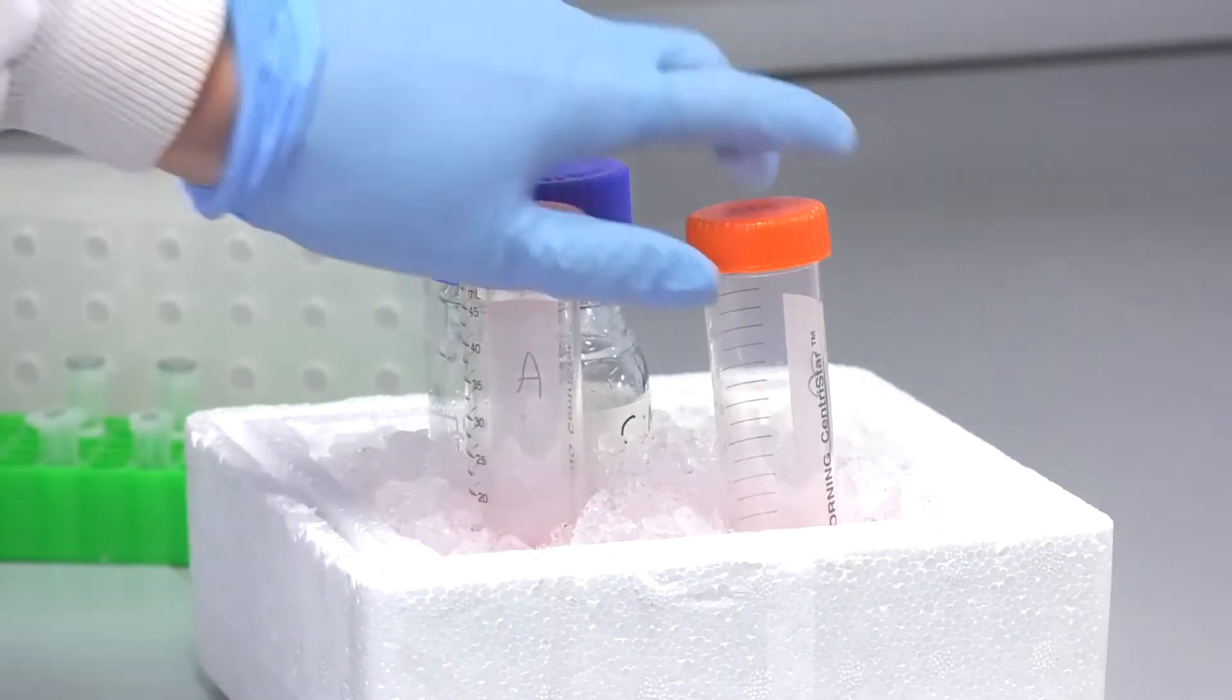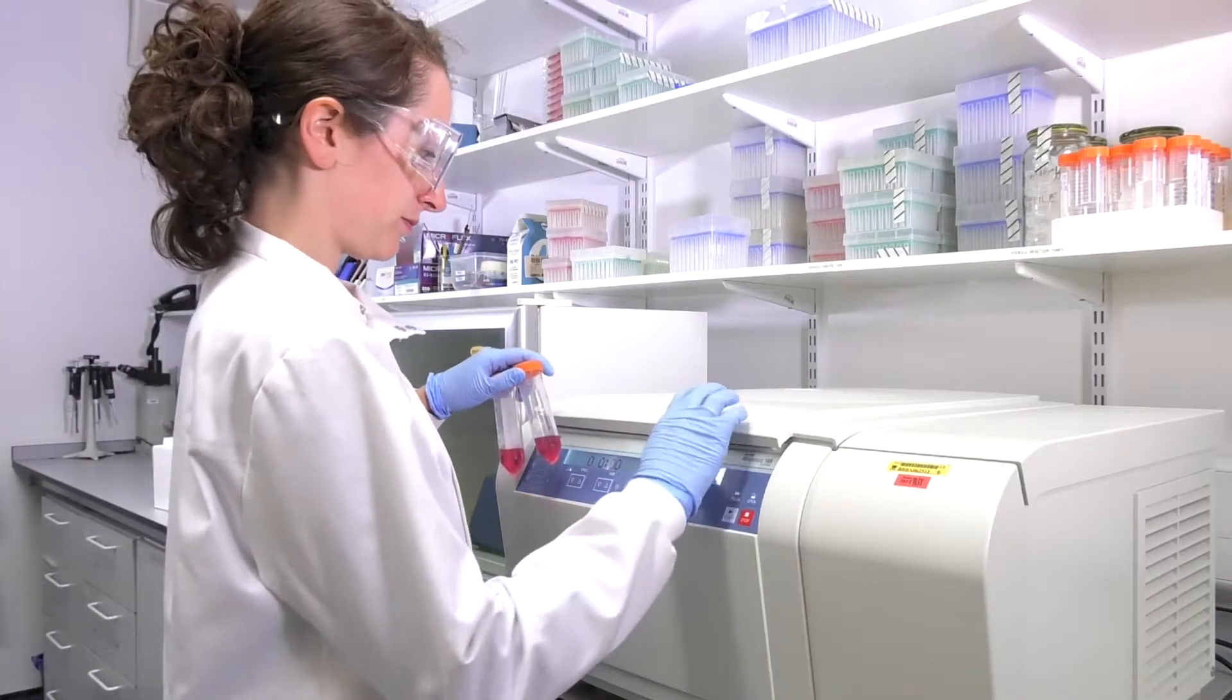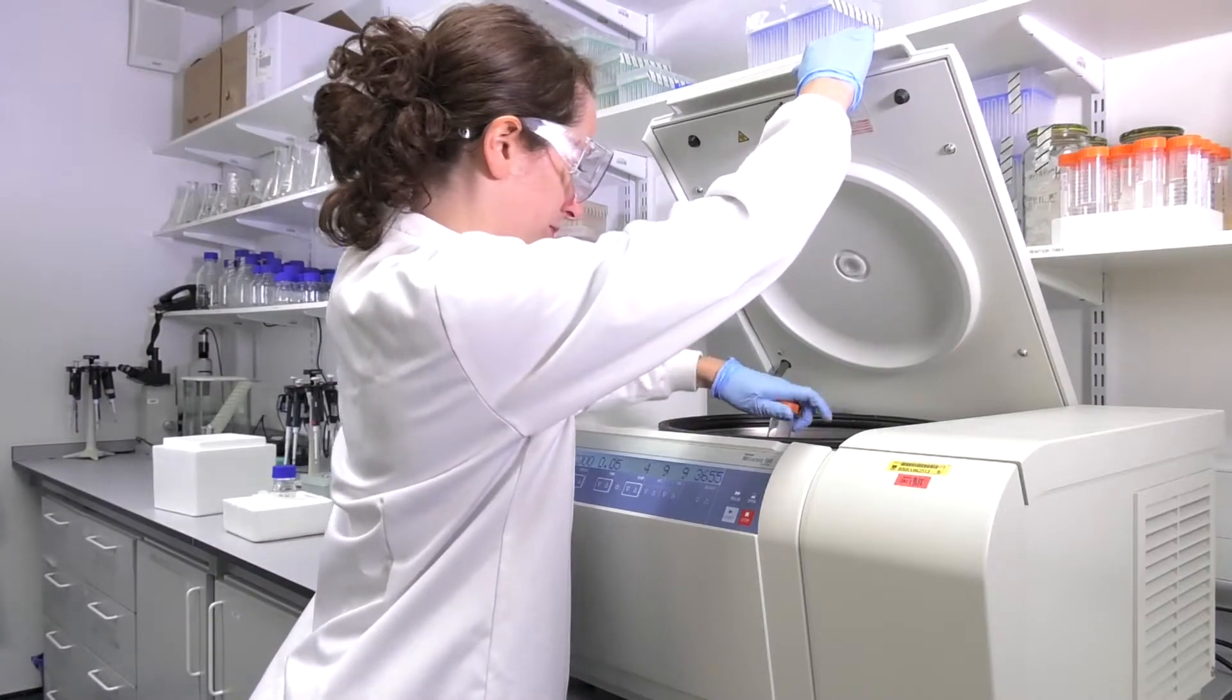Step 2. Centrifuge the samples and remove supernatant. You may wish to wash your cells at this stage, but please note that washing can interfere with metabolism.